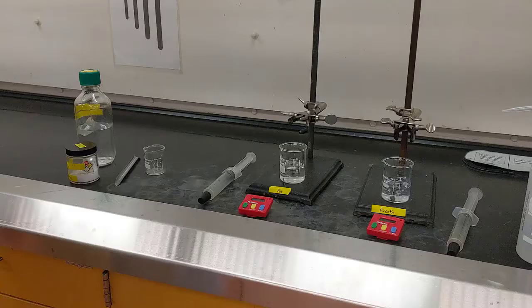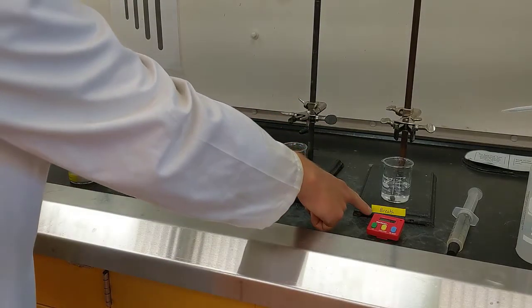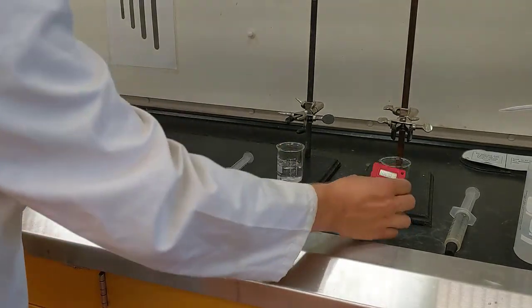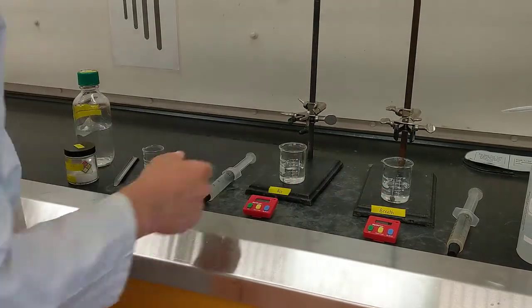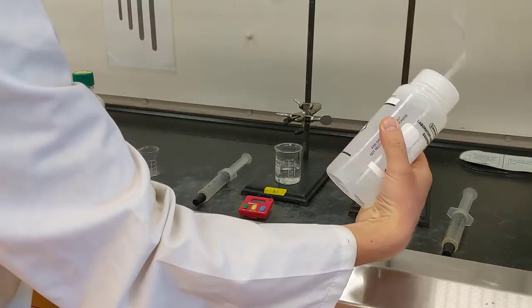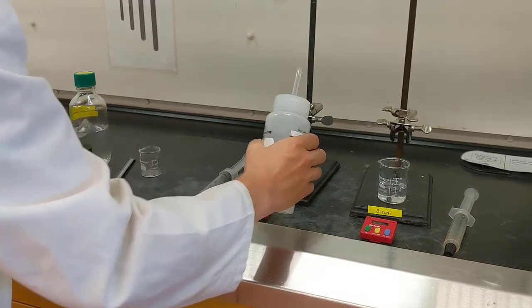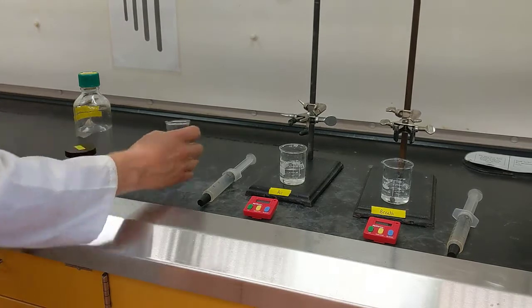The experimental setup is pretty straightforward. You'll want two beakers, and you'll want to fill them approximately half full with water. I've got one labeled as breath, and then the other one labeled as air. I've got two timers, one for each beaker, and I've got things pretty well labeled, that way I don't mix them up later on. Additionally, I'm going to grab some dish soap, and I'm going to put a small squirt into each beaker to help minimize the effects of the meniscus on the inside of the syringe. That will make it easier for measuring.